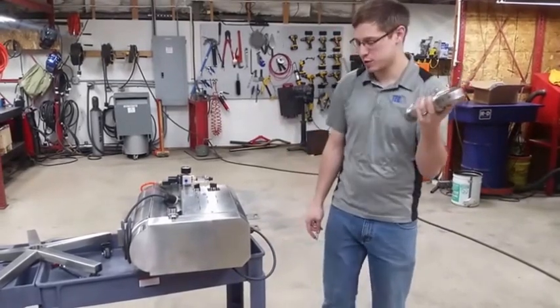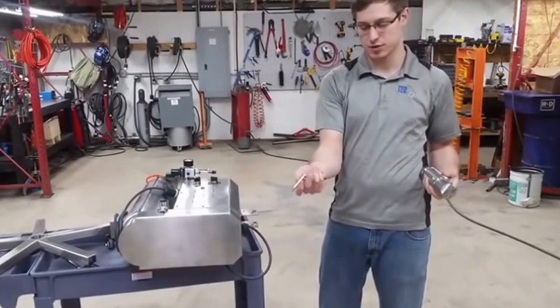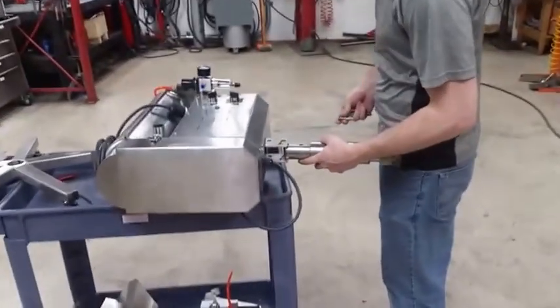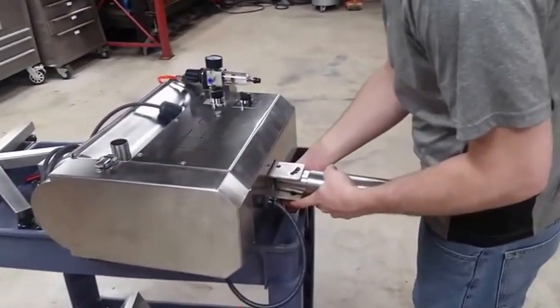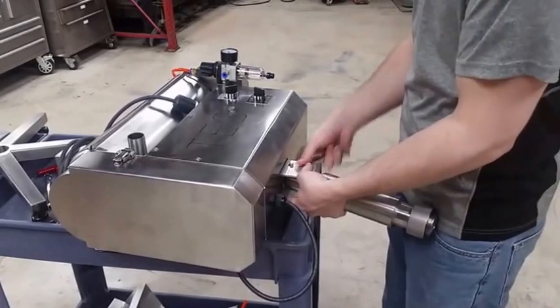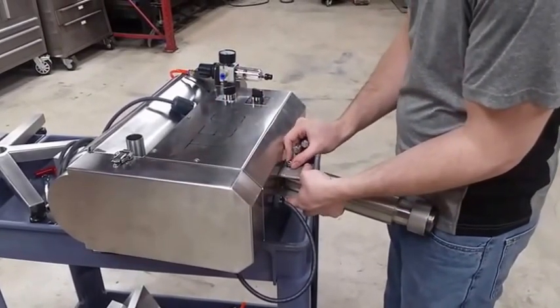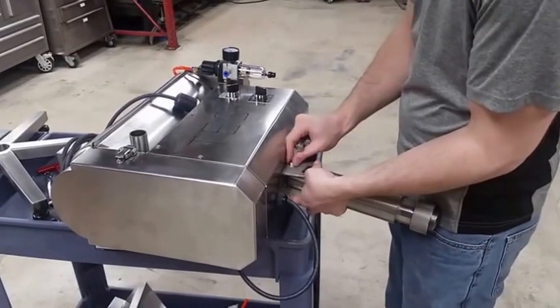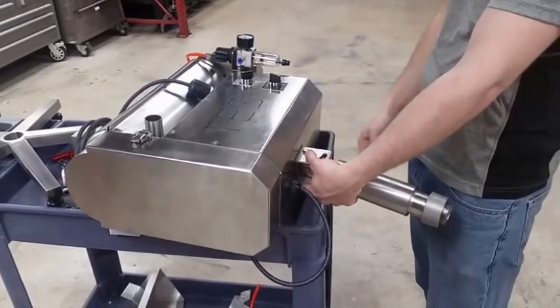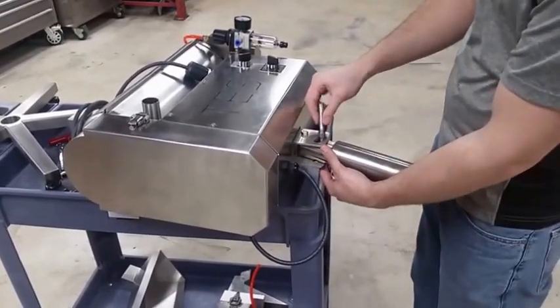To start, you're going to take the main post and take the lock bolts out of it — those are going to lock it in place when you put it back together — and the pin that keeps it attached to the base. This bolt is size 13 if you want to use a wrench, but it really doesn't need to be more than tightened by hand. It doesn't need to be super tight or anything, but if you want to you can use those.